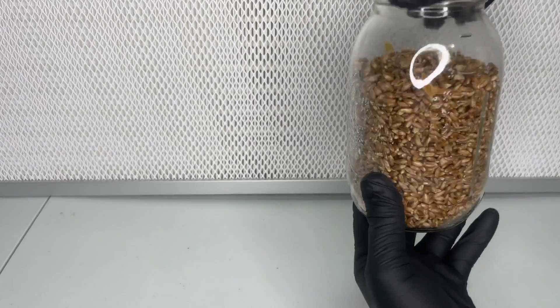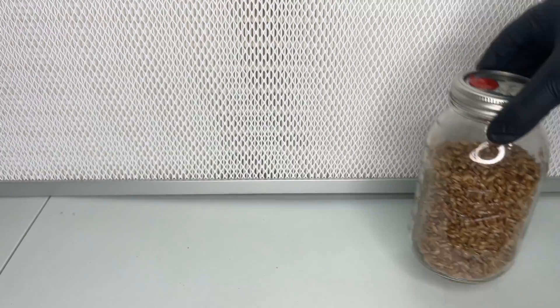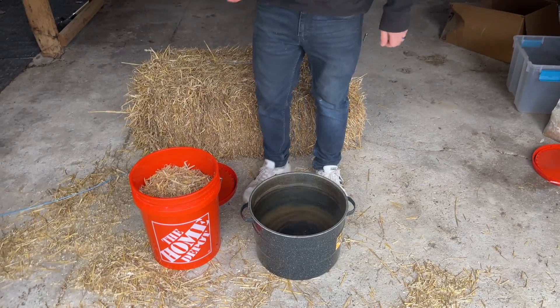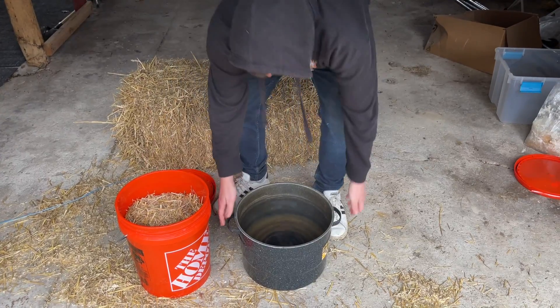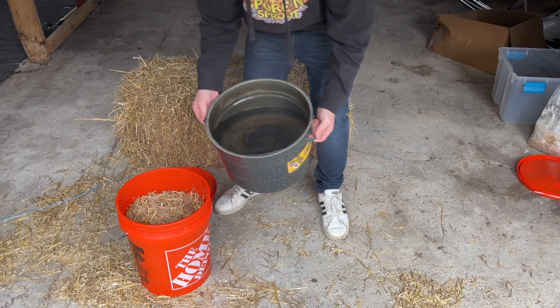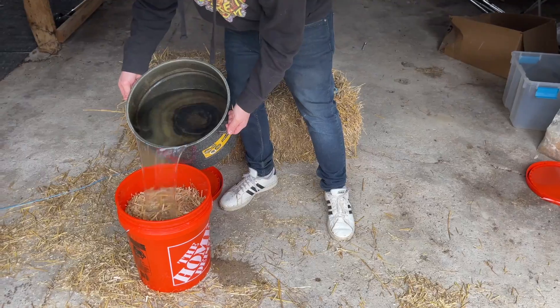The jar is then shaken one more time to distribute that mycelium to speed up the colonization process. After another week, the grain spawn should be close to full colonization, so now I start working on the substrate.